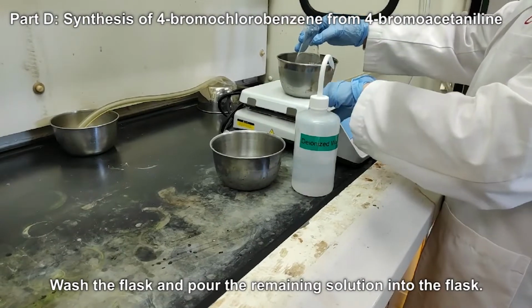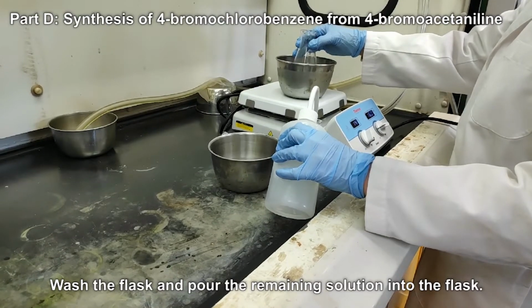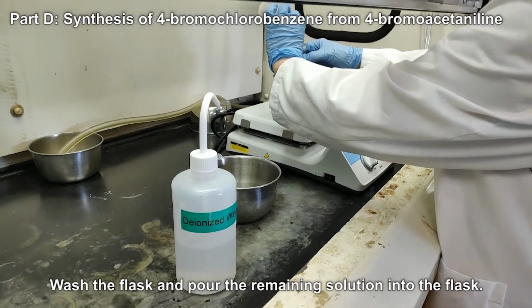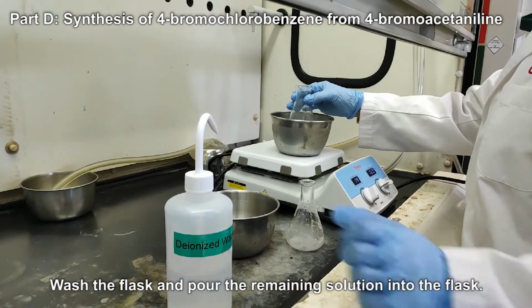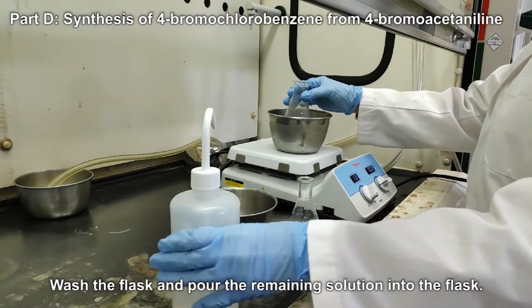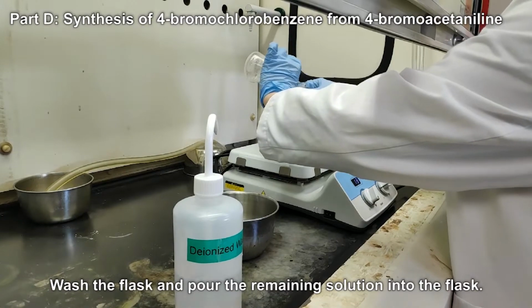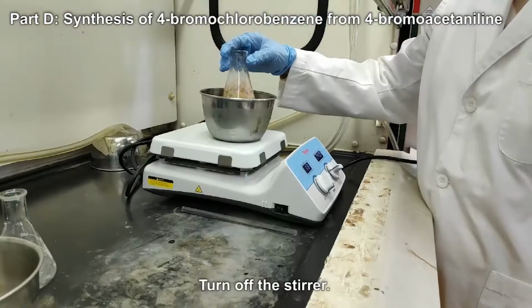Wash the flask and pour the remaining solution into the flask. Turn off the stirrer.